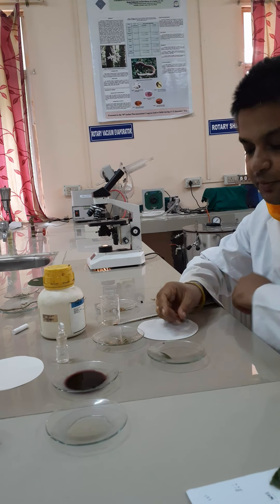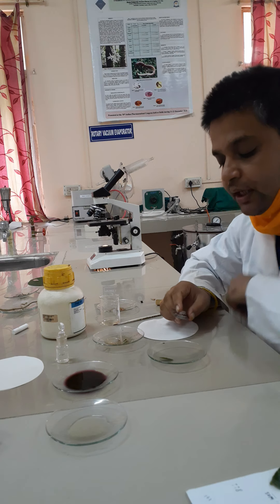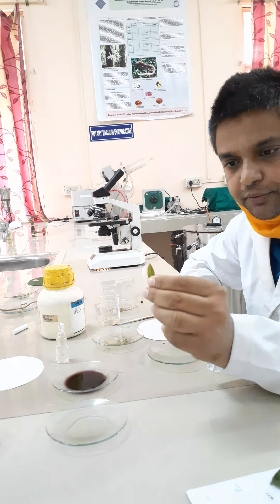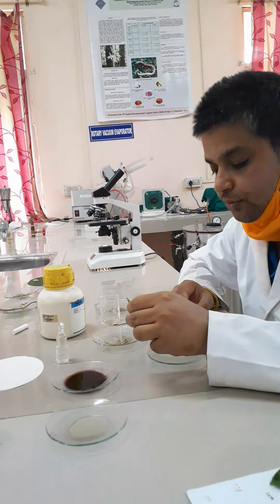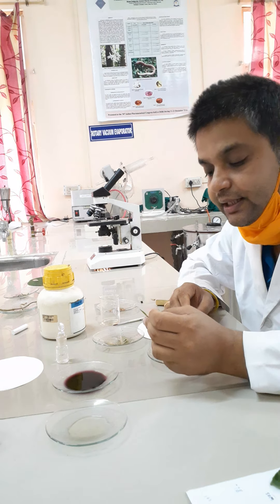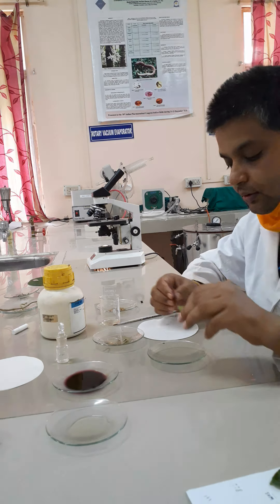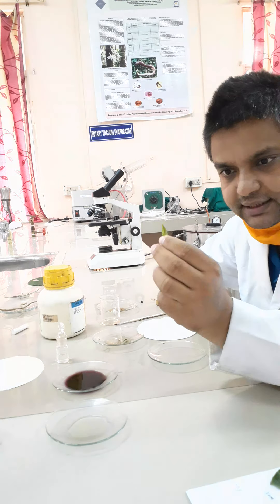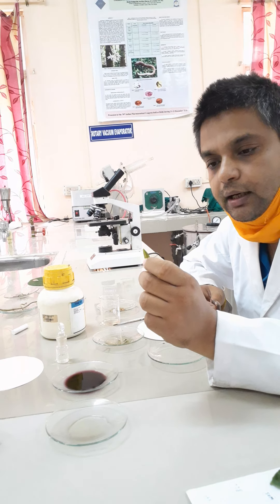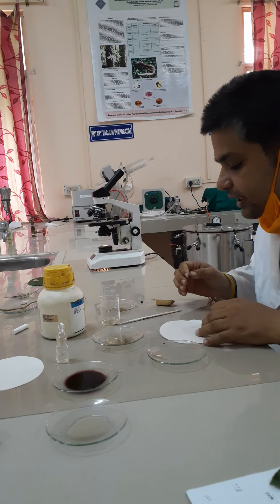In today's experiment we are going to take the transverse section of a senna leaf. It is a very small leaf. The procedure we are following here is the sandwiching technique. You have to take a section which consists of both the midrib and lamina region.